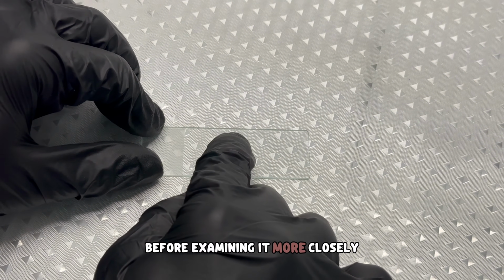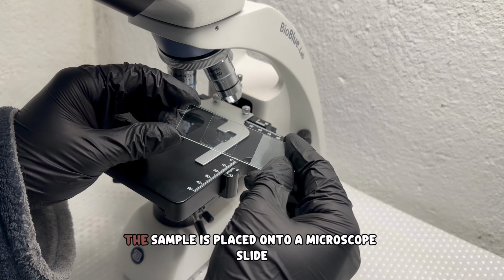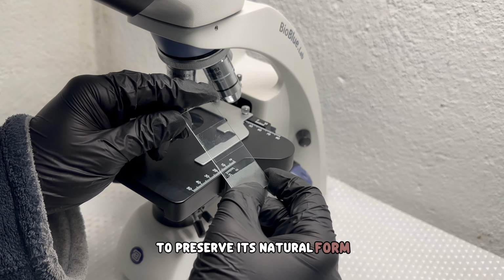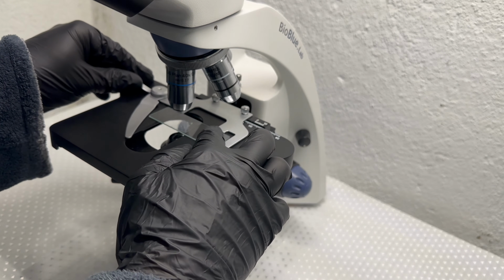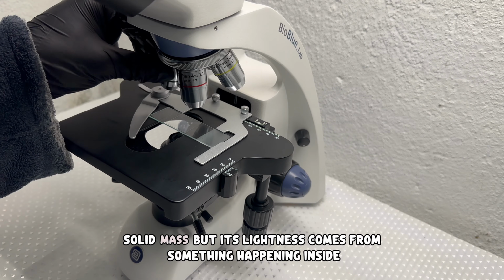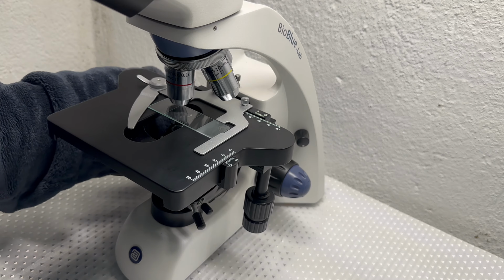Before examining it more closely, a small portion is carefully separated. The sample is placed onto a microscope slide to preserve its natural form. No additives, no artificial changes. At normal scale, marshmallow appears as a soft, solid mass, but its lightness comes from something happening inside.